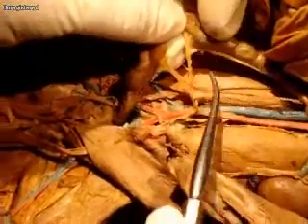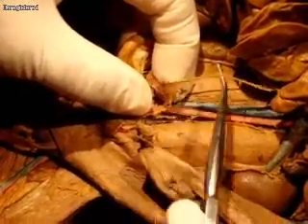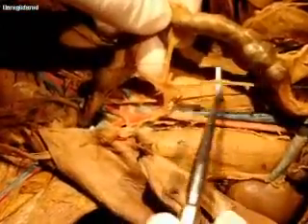This might have been one of the gonadal veins that's broken off. Continuing down, these are iliolumbar veins going to each side. It looks like a mesenteric vein — I think this is the caudal mesenteric and I think this is the cranial mesenteric. They come up and join with the splenic, which is right here, to form the hepatic portal vein.